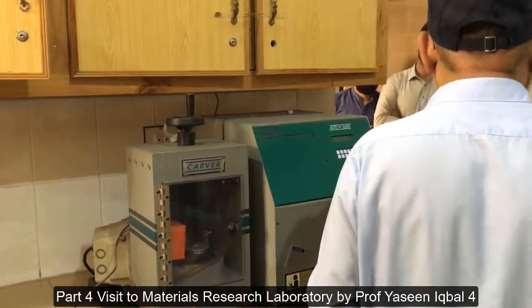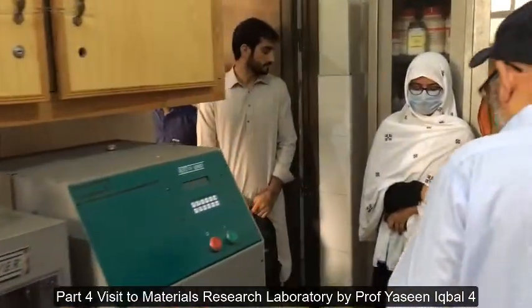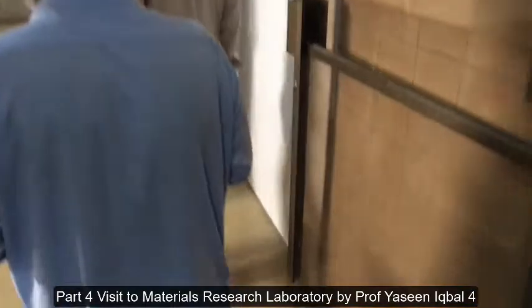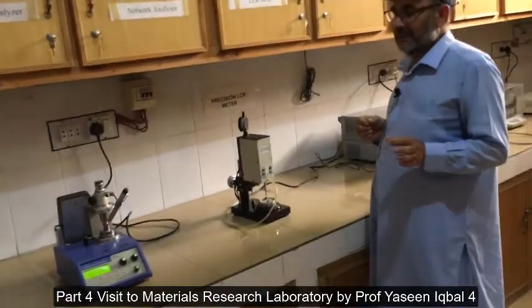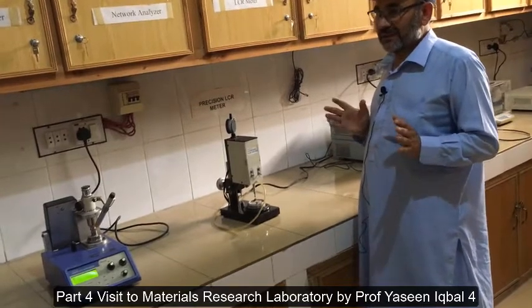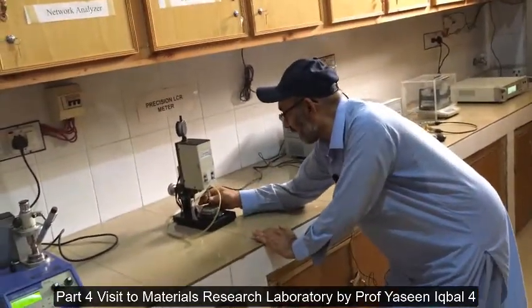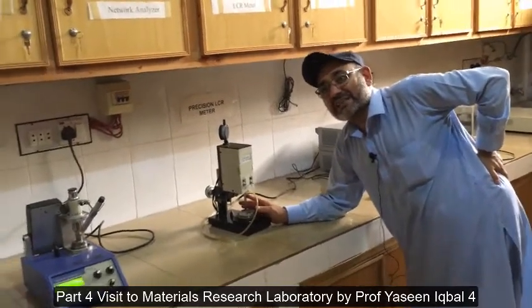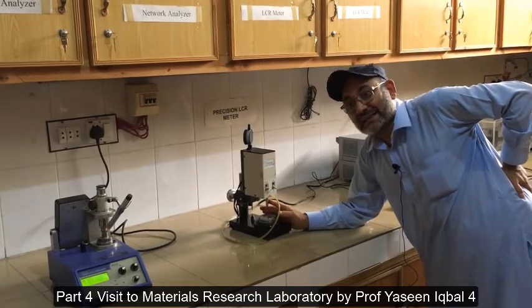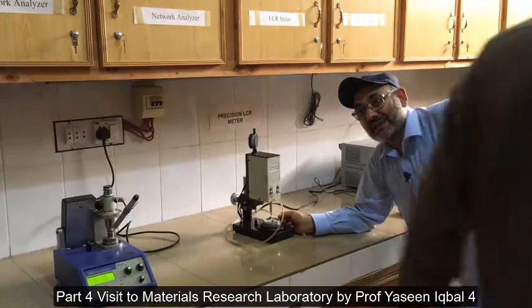For characterization of samples we have different facilities. I am always telling you in the classroom that we need small size samples for transmission electron microscopy. This unit here is called an ultrasonic drill. The diameter of the pipe you see here is 3mm.